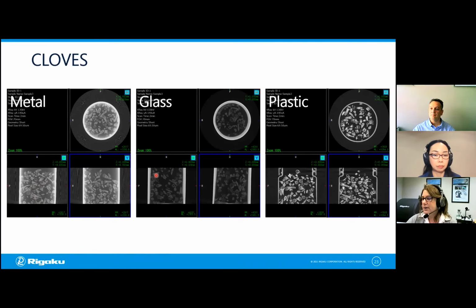I no longer want the larger stage. Instead, I'm just going to take this one out. It's better if you use 2 hands, otherwise I might drop it. So we've got our foam on there. And to hold this guy, I've got another sample stage. It's really easy. It just rotates in. This little disc or rod goes in, it's tightened, and there you go. Our sample's really high now, so we definitely need to bring it down before we go any further.